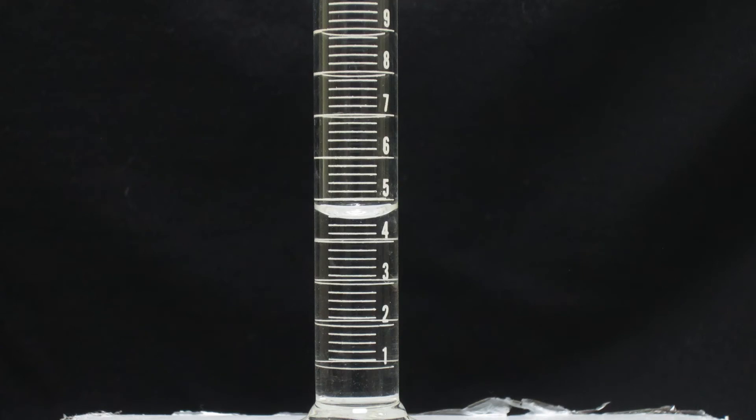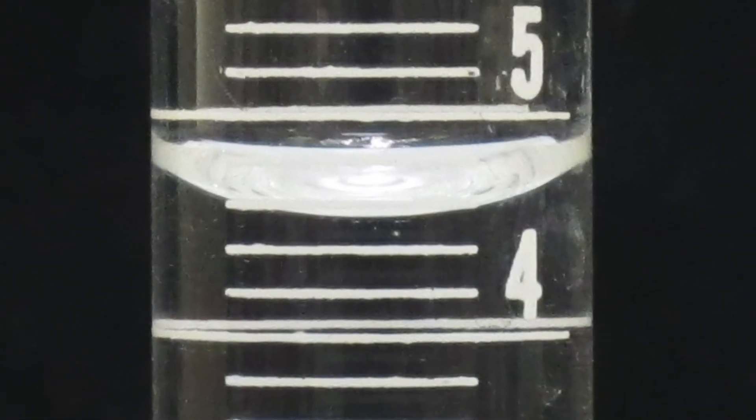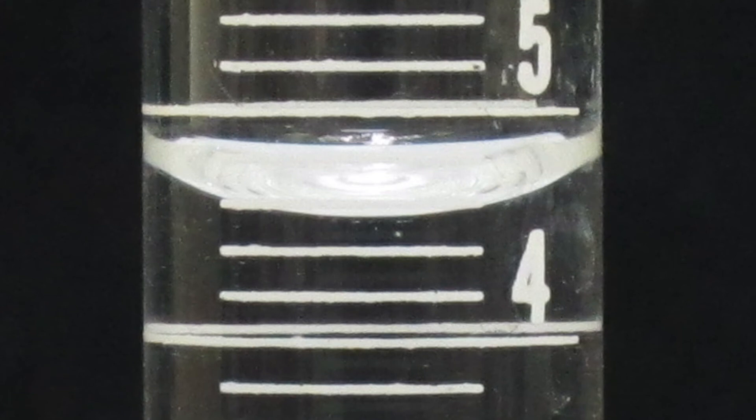Here's the graduated cylinder that I just took the mass measurement of. Zooming in on it so you should be able to see it pretty well. If you can't, send me an email.